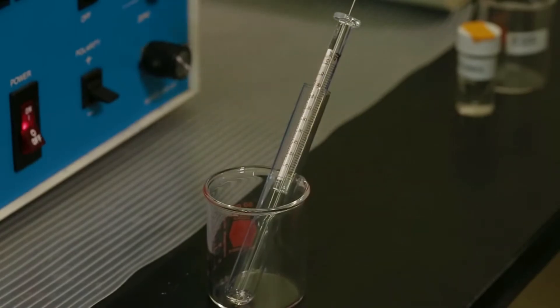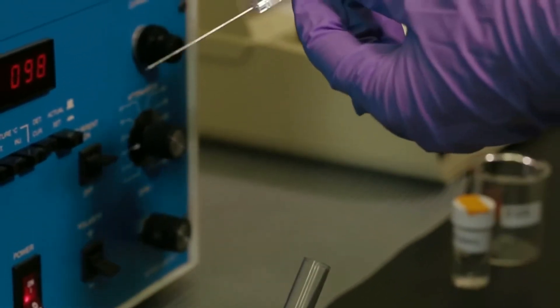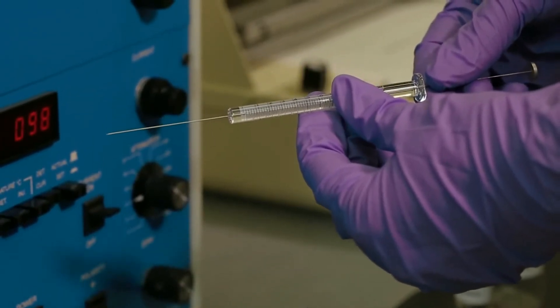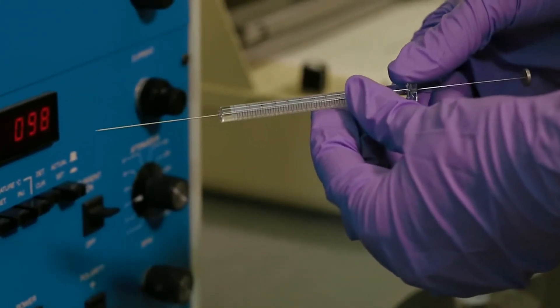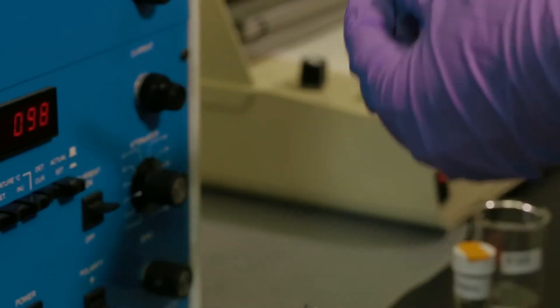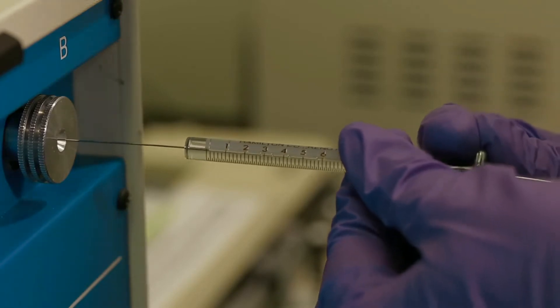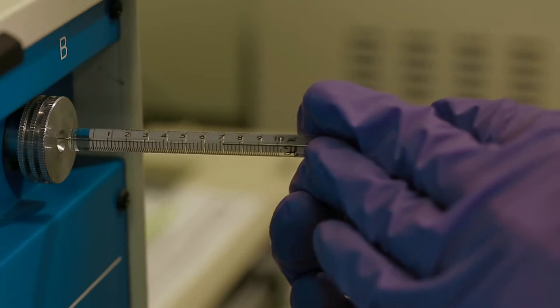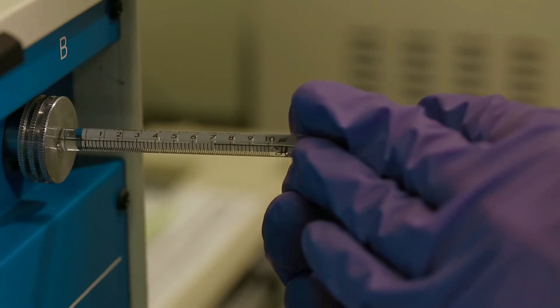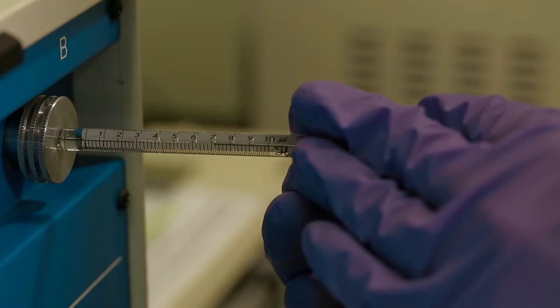To run a GC, you first need to prepare the sample for injection. Using a small syringe, collect between 1 and 5 microliters of the sample, followed by 3 to 4 microliters of air. Be sure that your sample is free of drying agent to avoid clogging the syringe. Once the sample is loaded into the syringe, insert the needle into the GC injection port. You will feel resistance as you insert the syringe — continue inserting the needle through this resistant material, called the septum, until the glass is flush with the injection port.